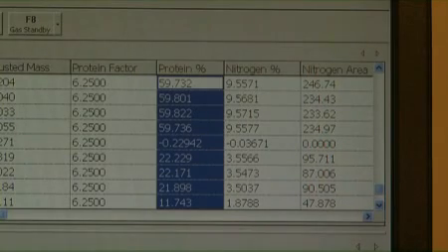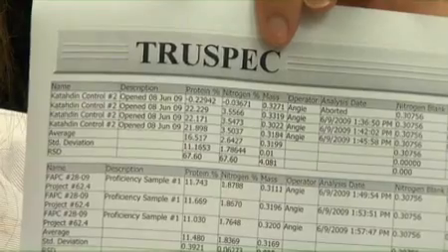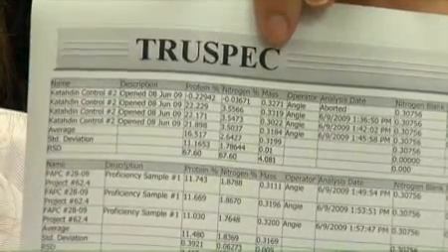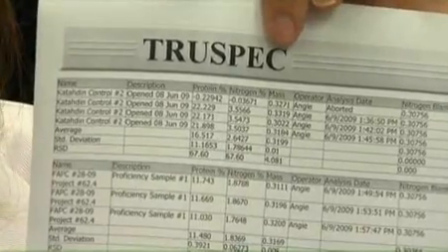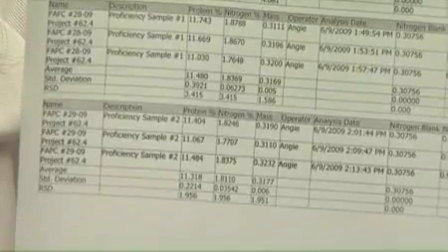Notice that the sample results are in the percent protein column. With samples, we look at percent protein, unlike blanks, which refer to nitrogen area, and drift runs that refer to percent nitrogen. Highlight the lines of any analyses that you would like to print in a report. Right-click and select Print. The LECO software groups sample IDs together and prints a report with statistics for each sample group. When applicable, the measurement uncertainty should be included with the result.